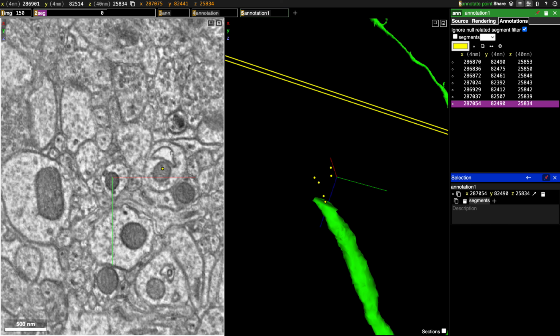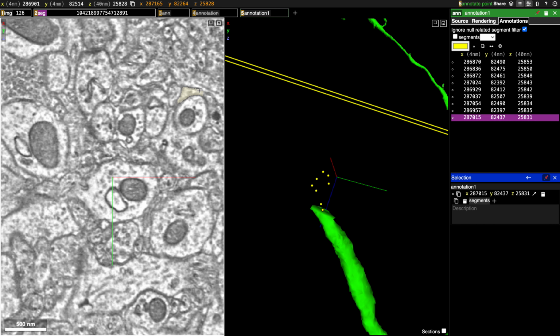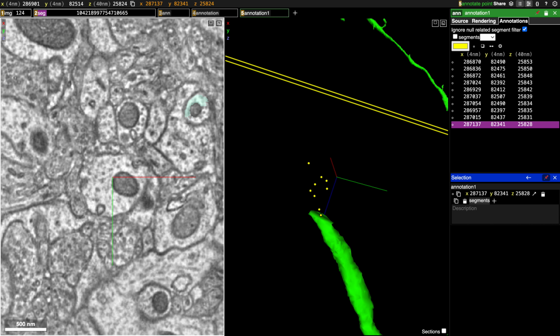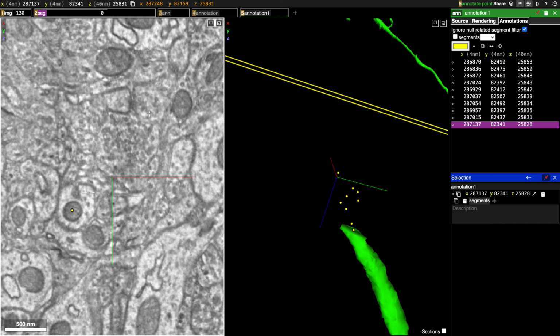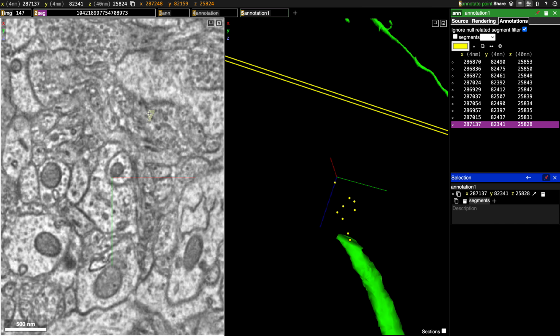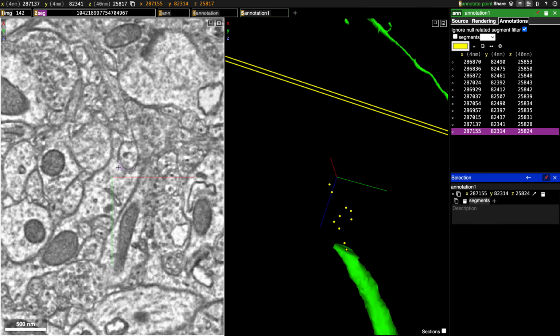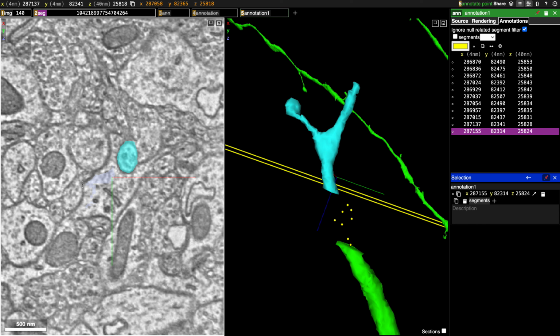You can see the same sort of structure that we have here, so I'm going to place a point there. Goes back up here. You can just keep going back and forth to sort of follow the direction of the cells. You can also right click to center to get a better idea of what you're looking at. Alright, so looks to me like it's following here. And then we're going to add in our next branch.